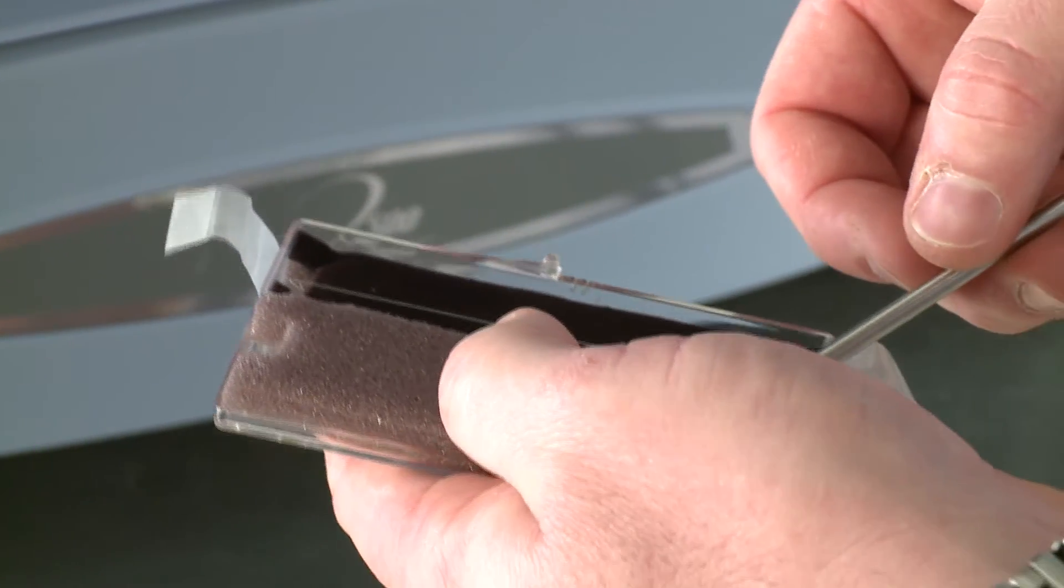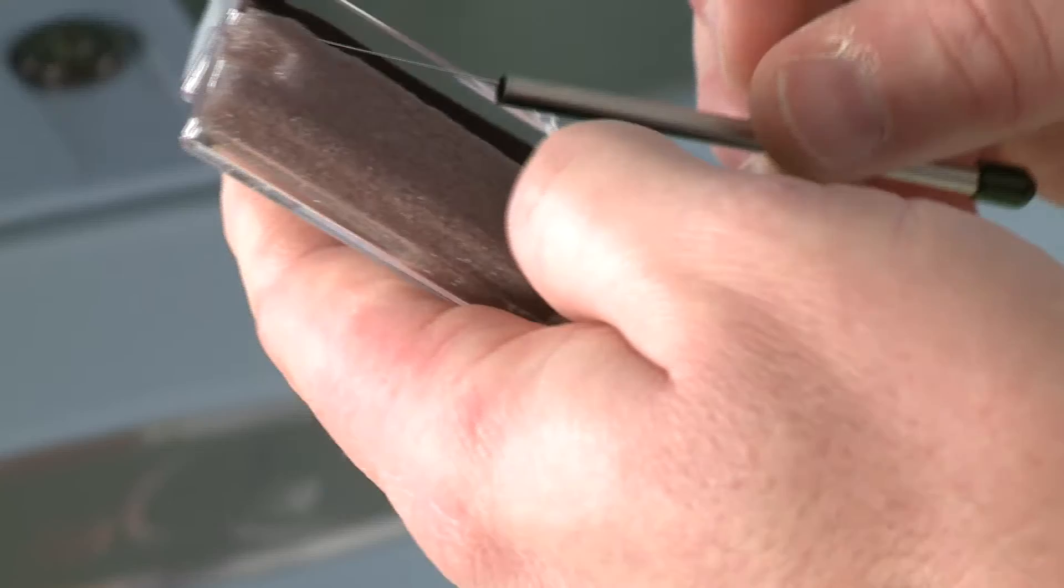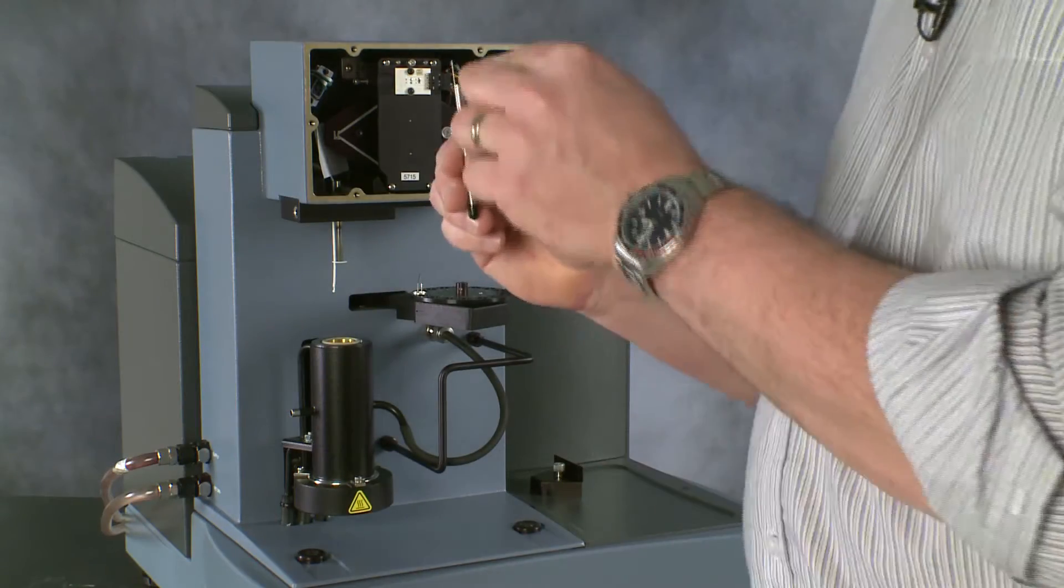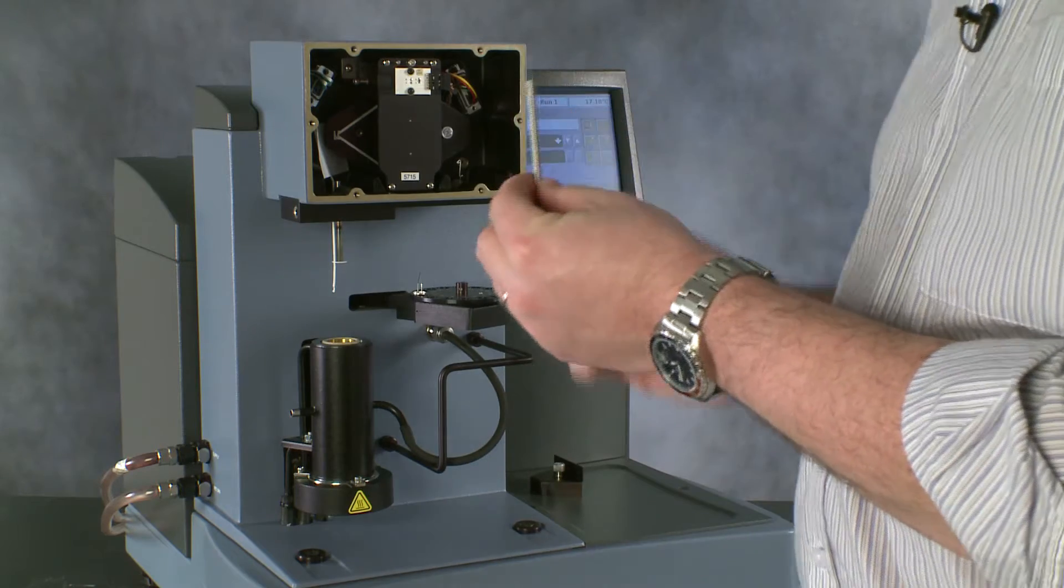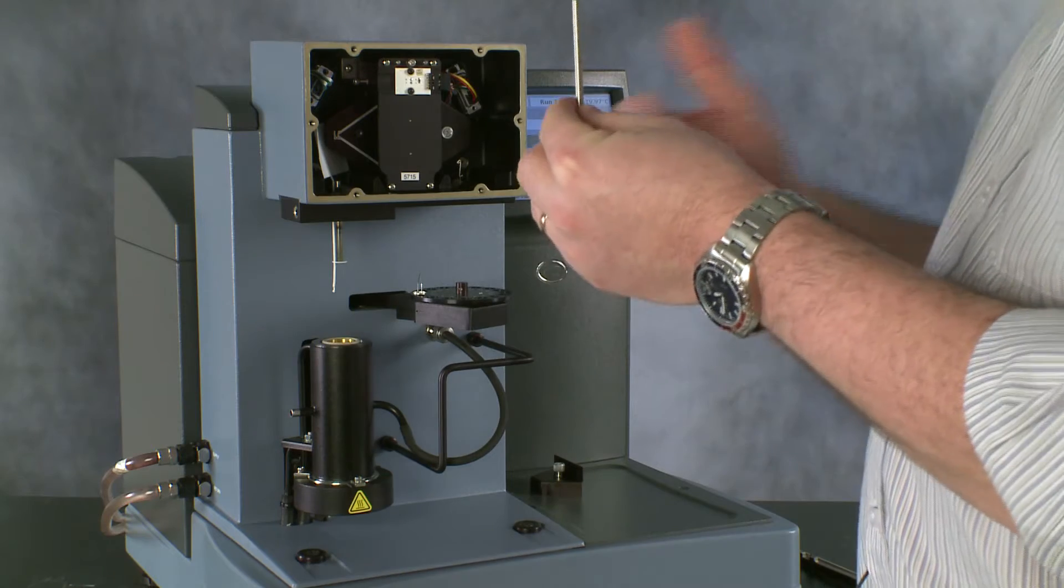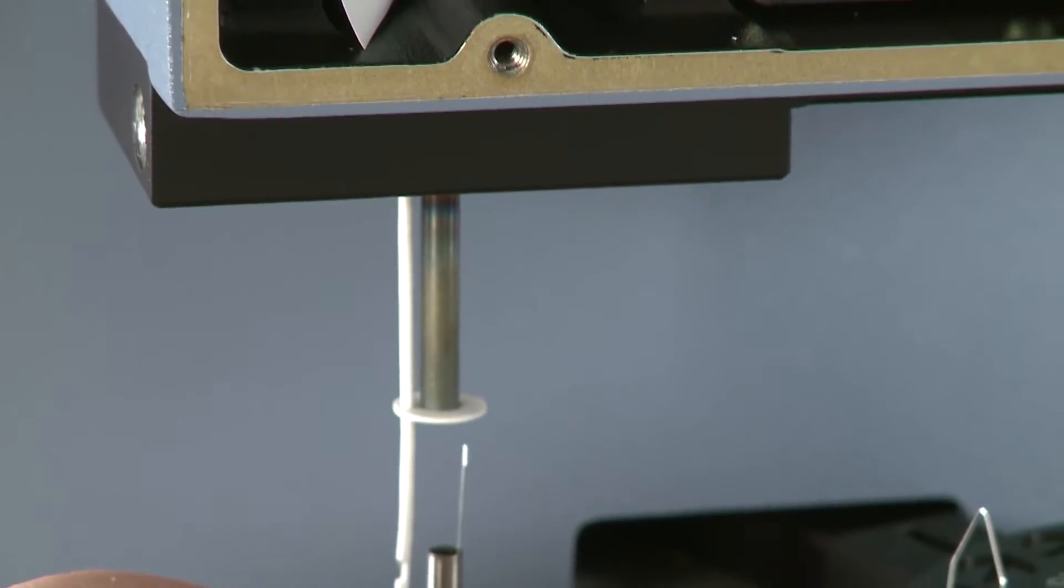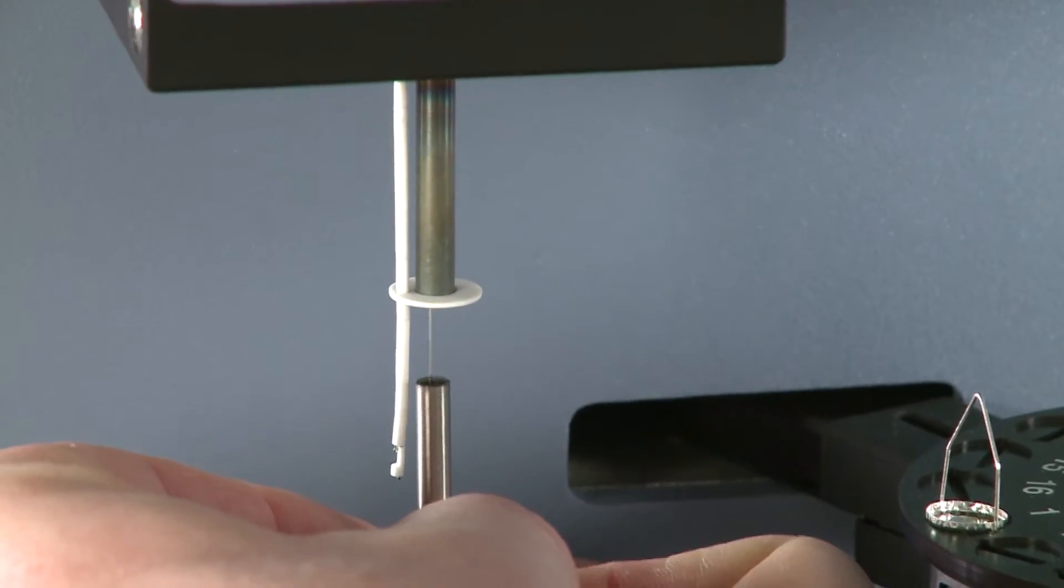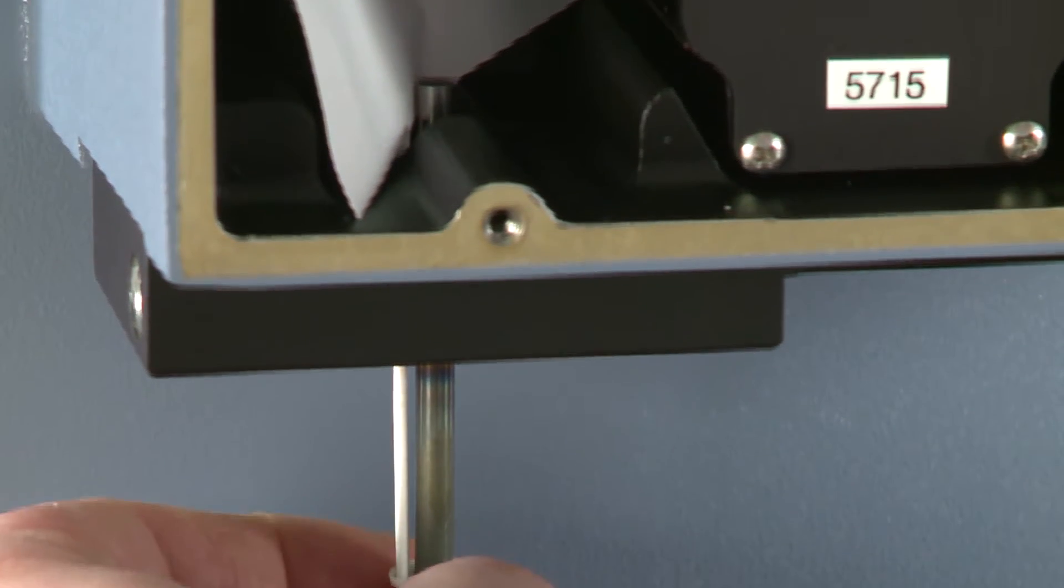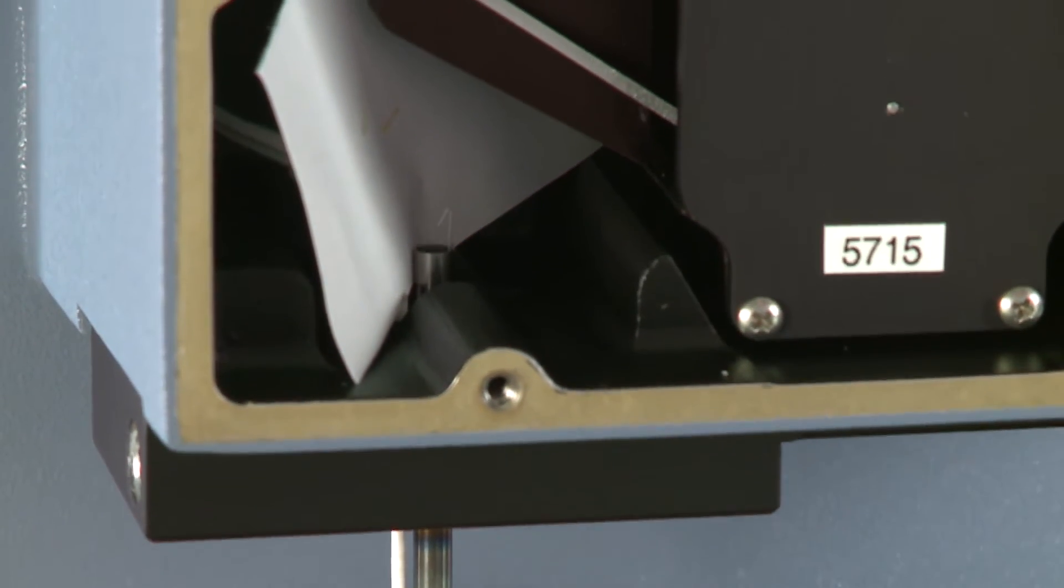So, we can feed that into our loading tube so that our double loop is free. And when we're loading this, we want to make sure that the double loop is pointing to the left of our balance. That way, the sample's coupling loop will be pointing in the right direction. So, again, we feed this carefully into the furnace and then up the thermocouple tube.